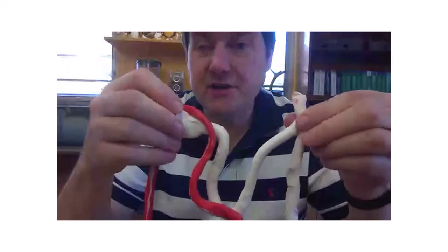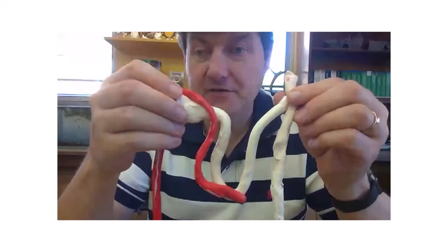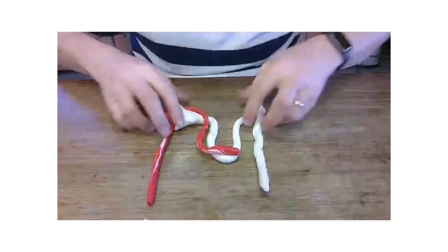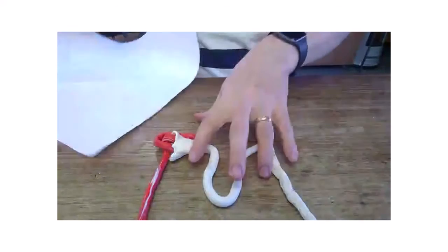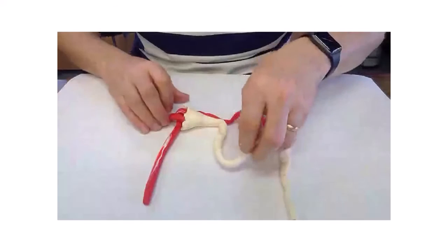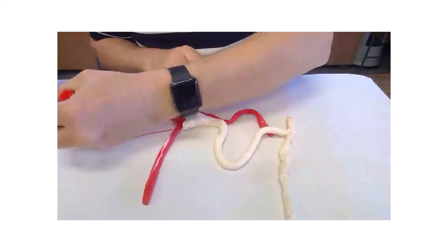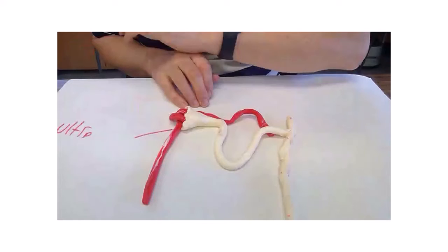And there are 3 different processes that take place in this nephron. And remember, there's 1 million of these in each kidney. And what happens is, let's angle it down a bit. So the processes that take place here, we've got, I can't write upside down.